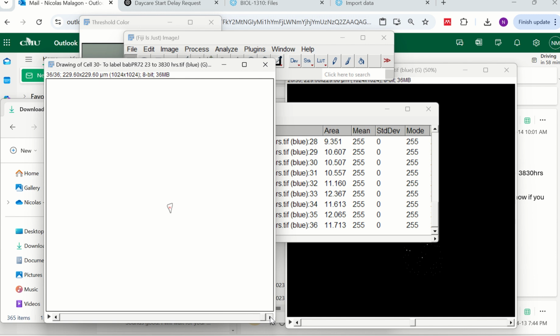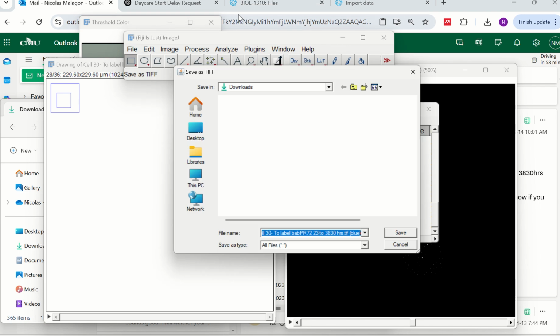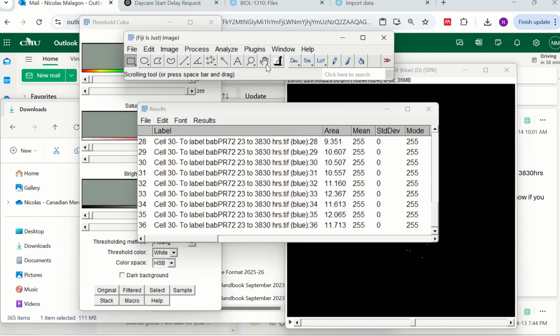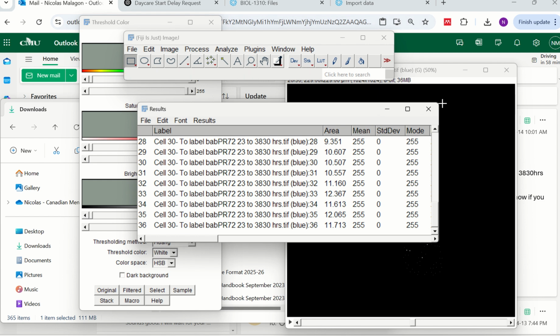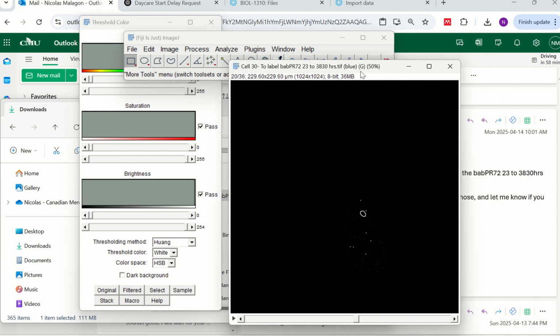And you make sure that it didn't measure the dots. If you see, there are 36 slides, and this is the 36th. It measured all of them as you have been doing, and it didn't measure the dots. And you can again save this one. This one is the drawings. I call it drawing of cell binary. And here I also saved this as cell 30 results, and this is how you can solve that problem that I showed you before.